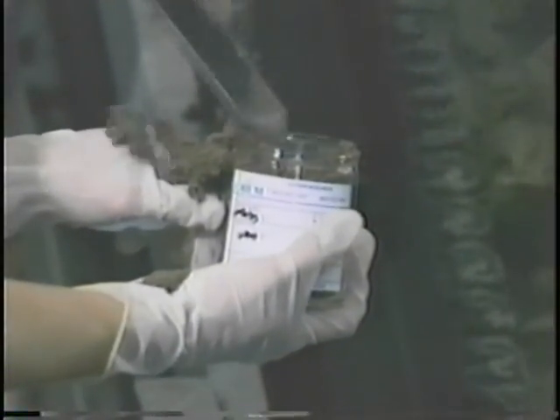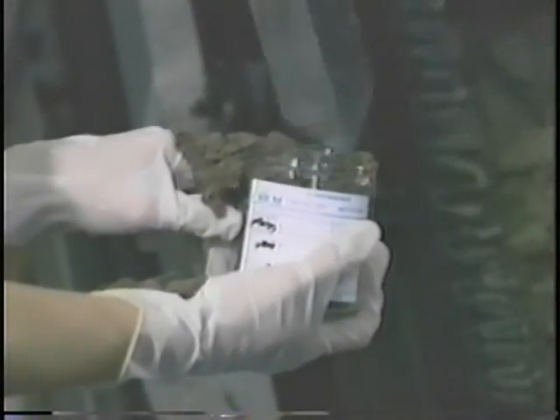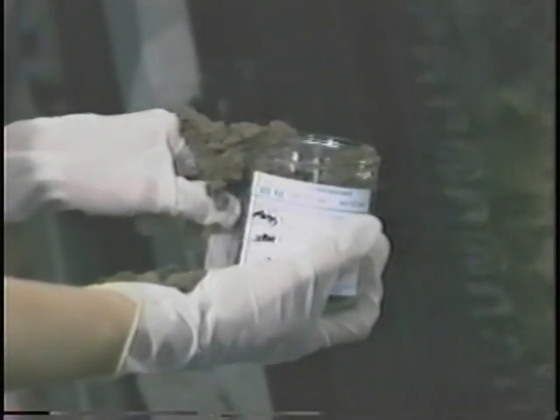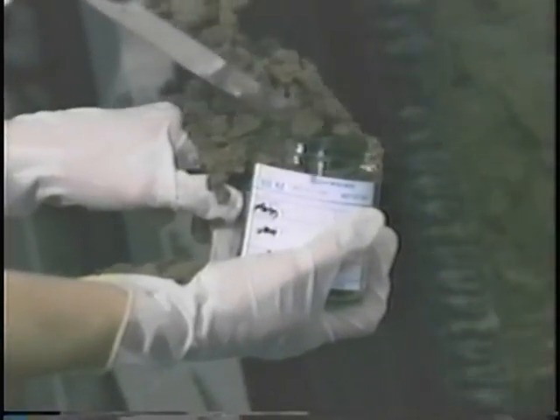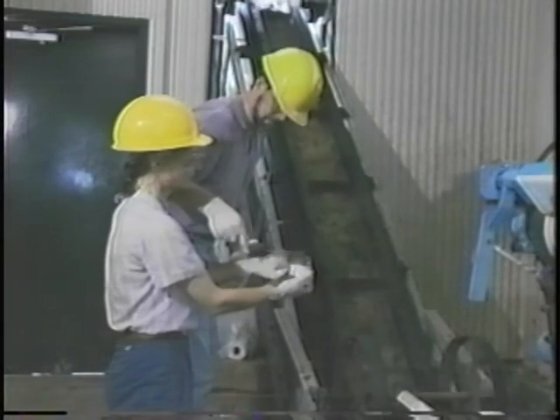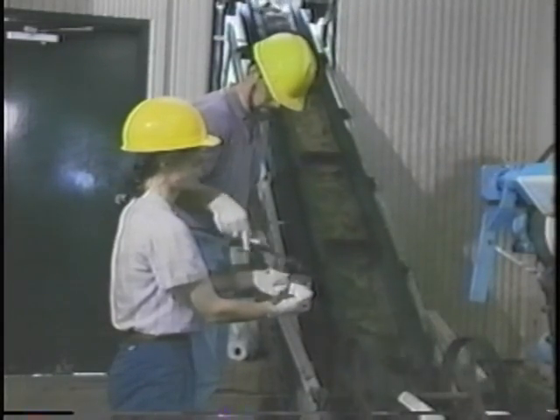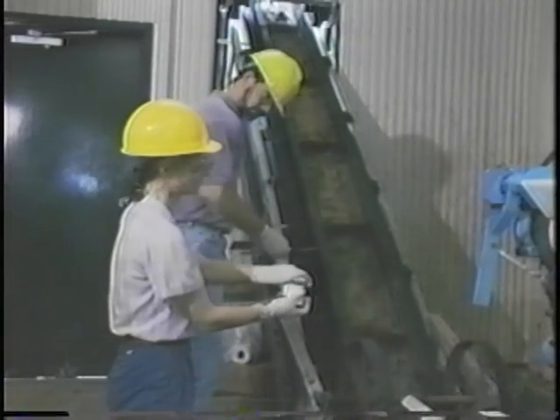Volatile organic samples must be collected to minimize volatilization of the pollutants. Fill it completely, packing the sludge in and filling it to overflowing so that when you put the lid on, there is no air space for volatiles to escape. Remember, samples for organic pollutants require glass containers with Teflon-lined caps.